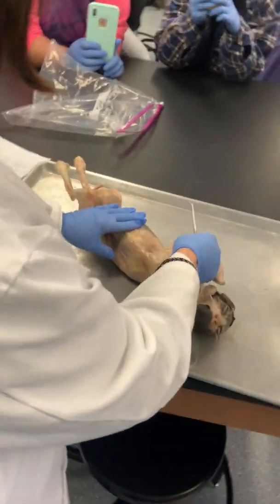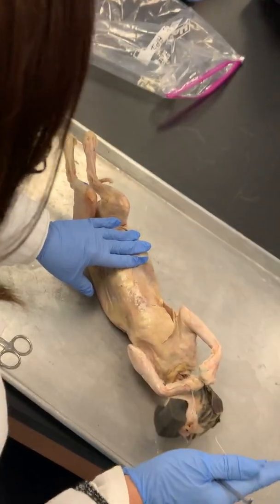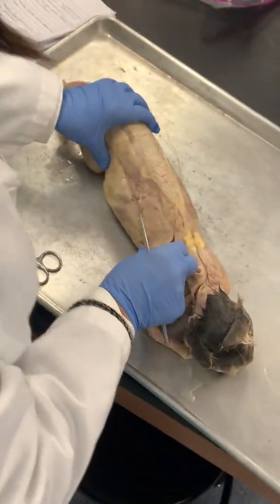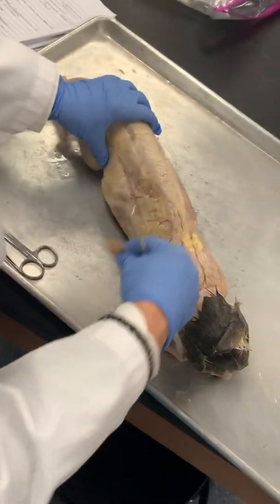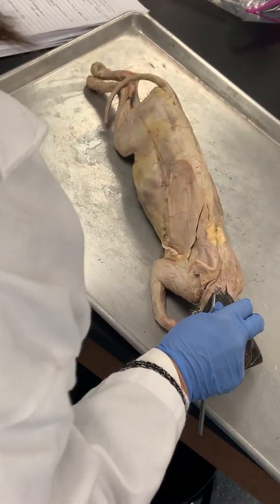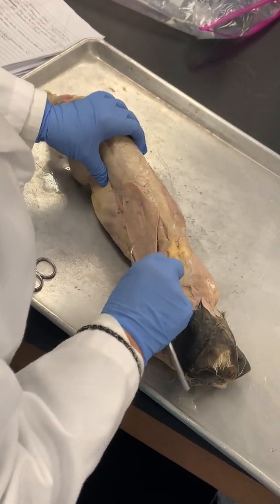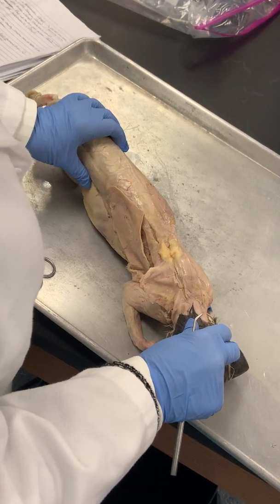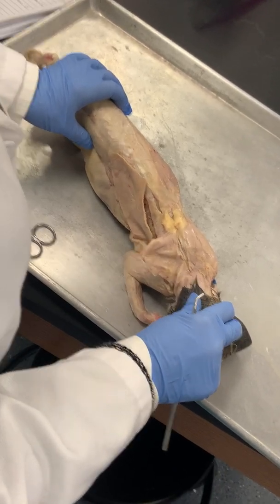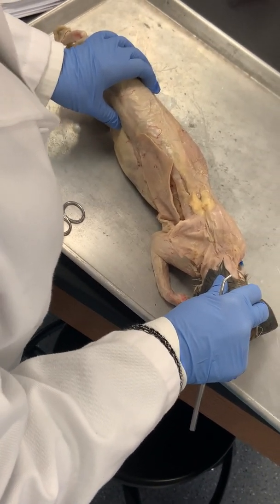You have to peel off other stuff. What muscle is this? Pectoralis major — and you can't put 'pecs' on the test or you're going to lose some points. This muscle here, latissimus dorsi — does what movement? Adducts the arm, or arm down and back. This muscle here, trapezius — what does that do? Retracts, well it pulls them up too, shrug — you could say raises scapula, shrugging shoulders, keeps head erect.